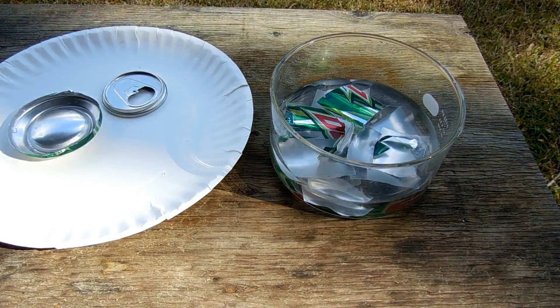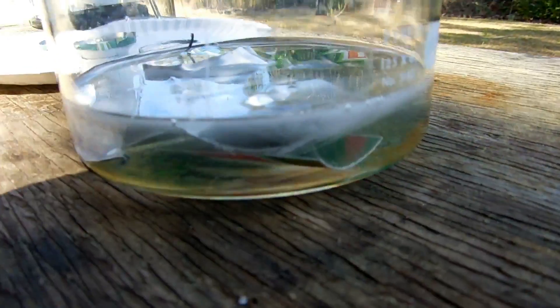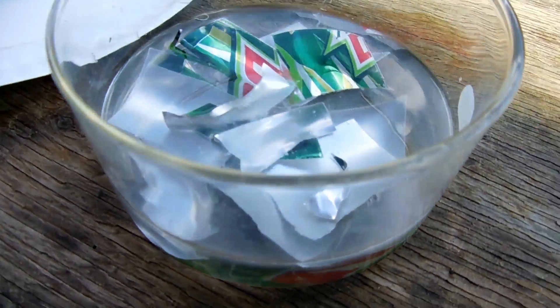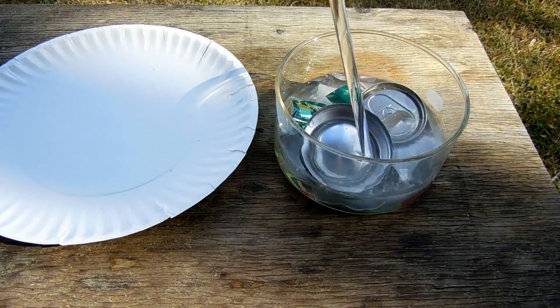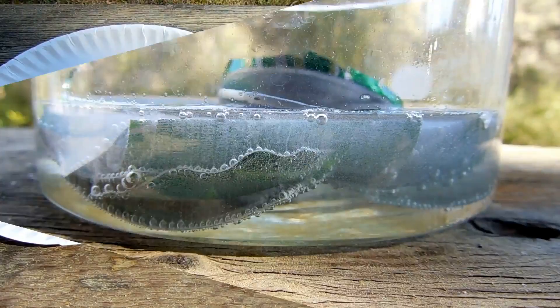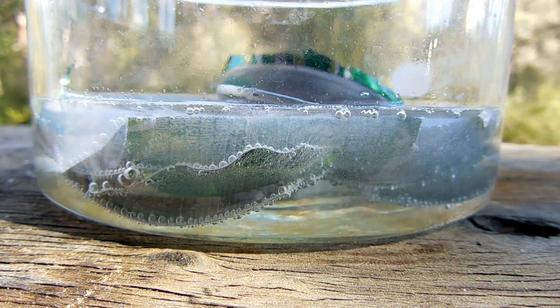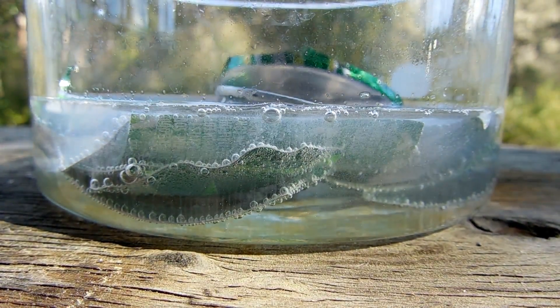You can see some of the pieces are already reacting pretty vigorously — you can see the bubbles, especially from the cut sides. It's going to take a while for the hydroxide to work its way through the label and the plastic. The cool thing about using potassium hydroxide first is that aluminum is amphoteric, meaning it can react as either an acid or a base, and not a lot of metals do that. By reacting it with the base first, we should get the aluminum in solution and keep all the other garbage out as a precipitate.